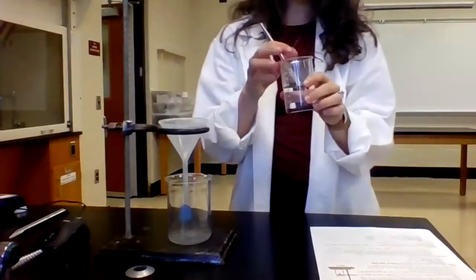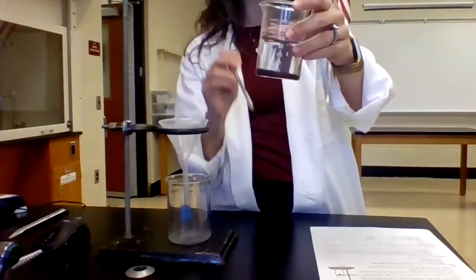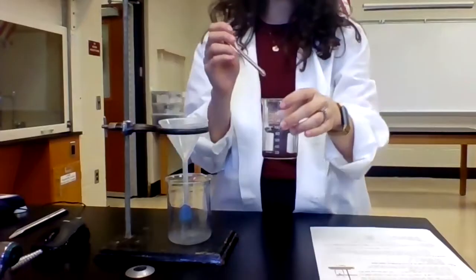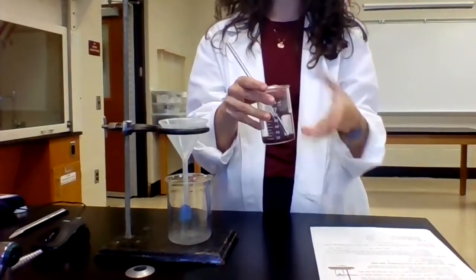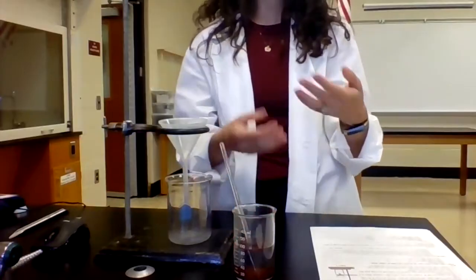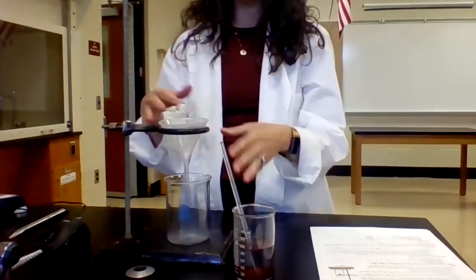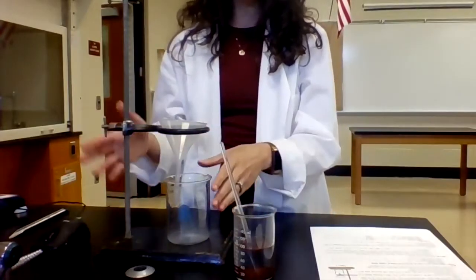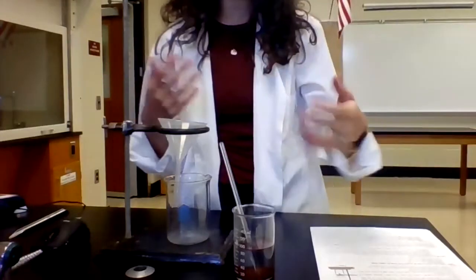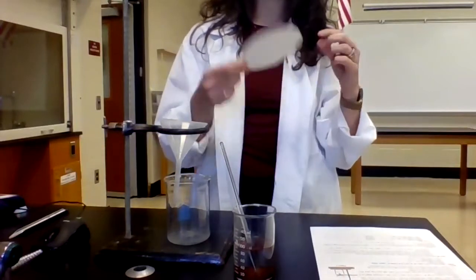All right, so now that I have quenched my excess zinc, you can see in the beaker here again, that reddish brown solid, that's the copper metal. I need to collect my product so that I can weigh it and use it to determine the empirical formula of the copper oxide. So I have a filtration set up here with a funnel. I'm using a ring stand and the iron ring just to make it more secure so that I don't accidentally knock it over. And I'm gonna take a piece of filter paper and I need to weigh it.